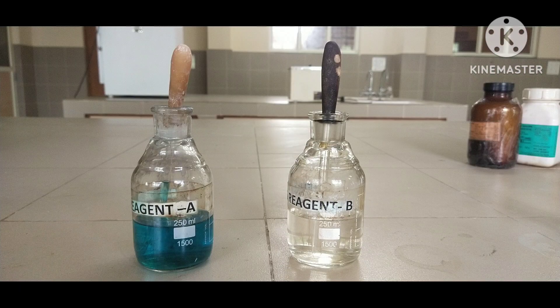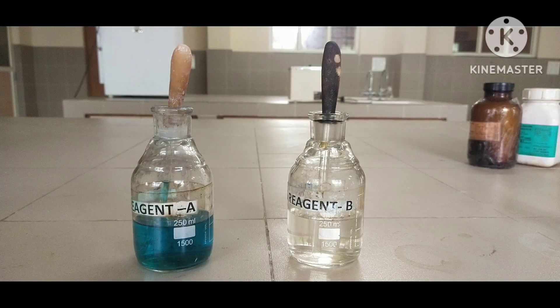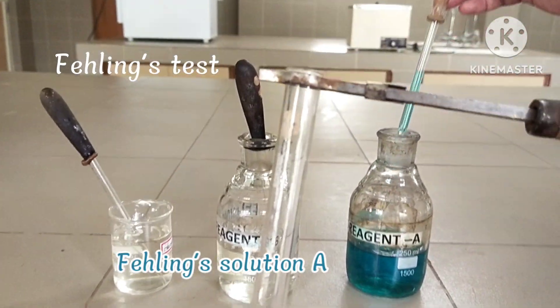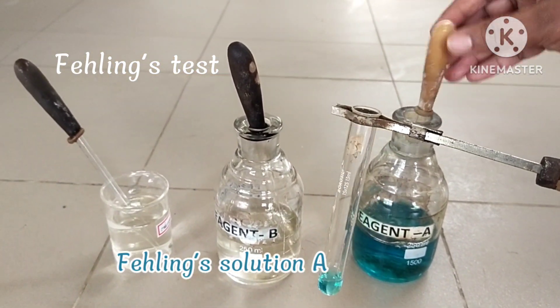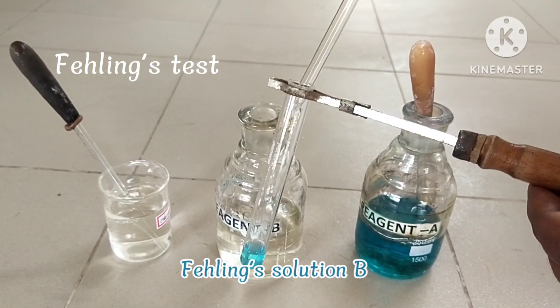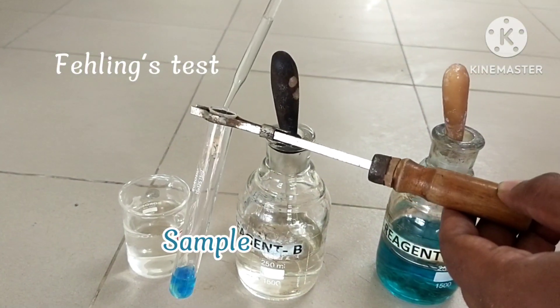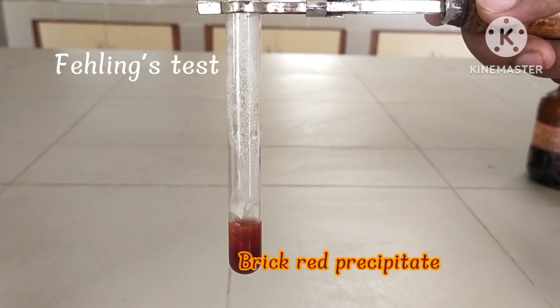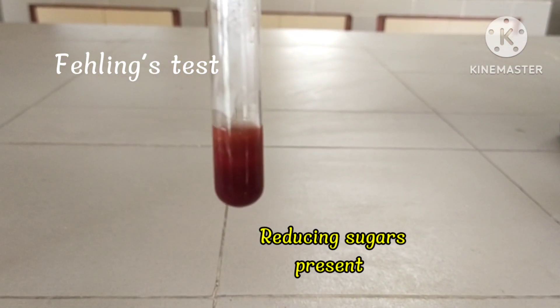These are Fehling's reagent A and B. Procedure: To the test tube, add 2 ml of Fehling's solution A, 2 ml of Fehling's solution B, and 2 ml of sample solution. Boil the solution. Brick red precipitate appears — reducing sugars are present.